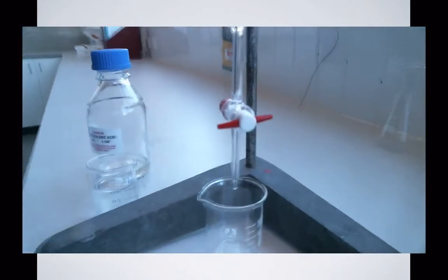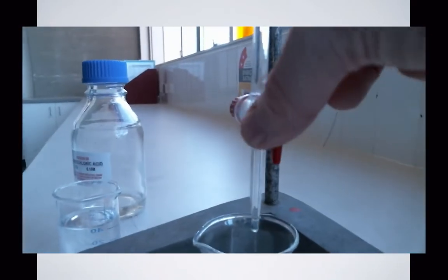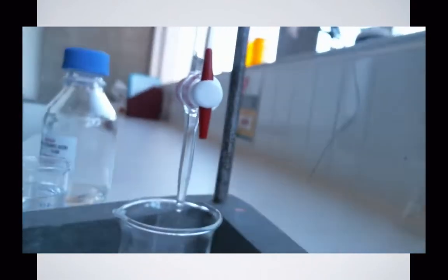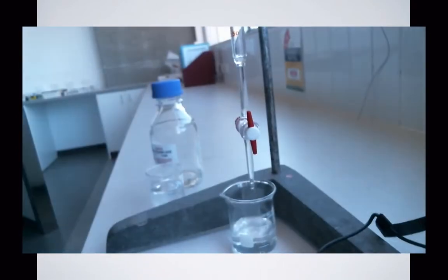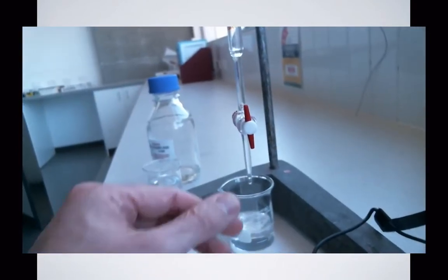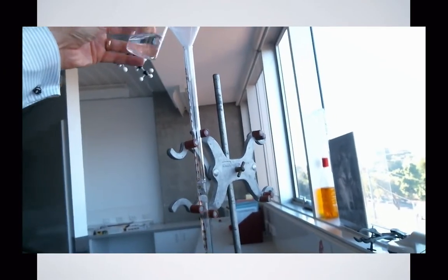Now remember, before you fill it for the final time, you're going to rinse it, so I'm emptying all the liquid out here. Just speeding that up a bit because it takes a while for all that liquid to empty out. Here we go, we're filling it for the final time with the solution that we plan to have in it.